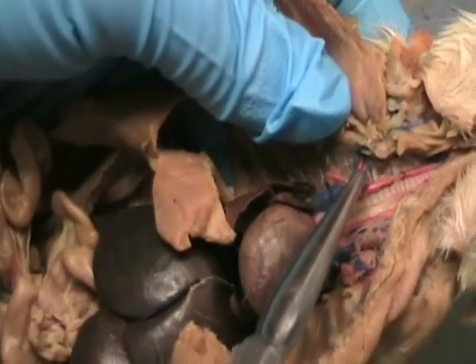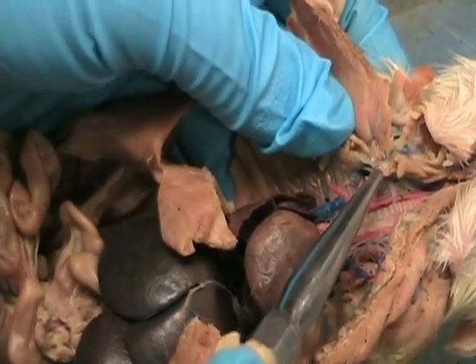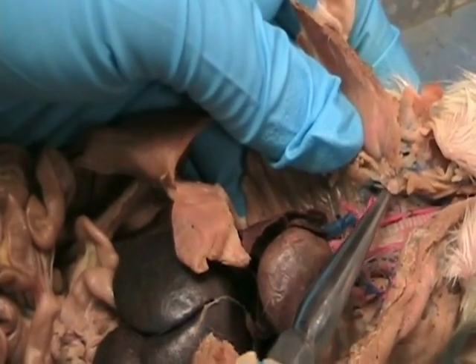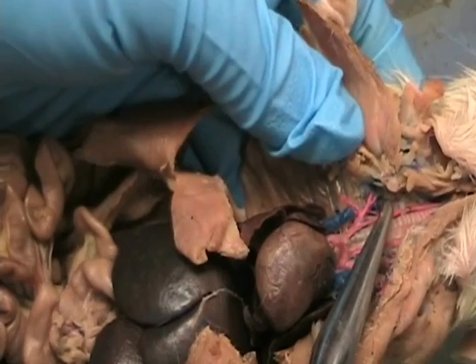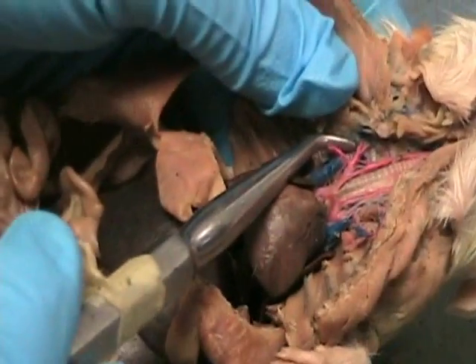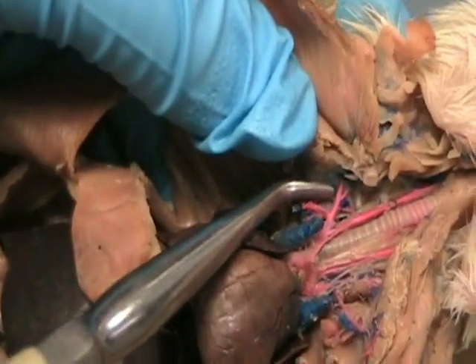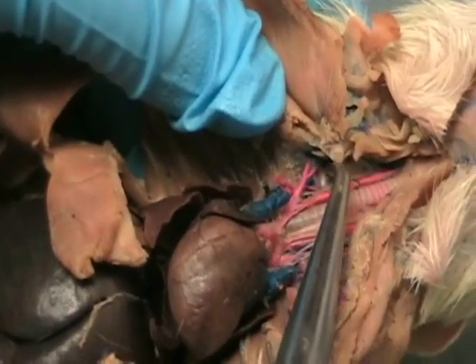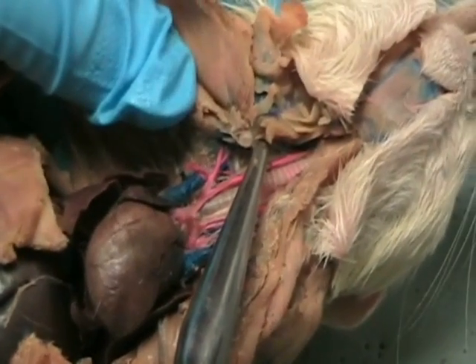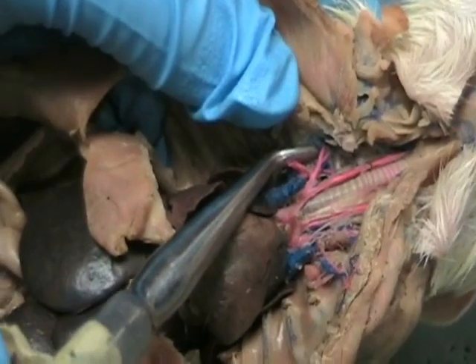Then the subclavian ends where you see the split. Okay? So once it branches off into two different ones, it is no longer subclavian. The two branches have their own names. The one on the top is called the superficial cervical artery. The next one down, the one going towards the bottom, is the axillary. Okay, so wait, can you say that again? Yeah. So the one where the subclavian ends, you get a branching. The top branch goes to the superficial cervical artery. The one on the bottom is the axillary artery.